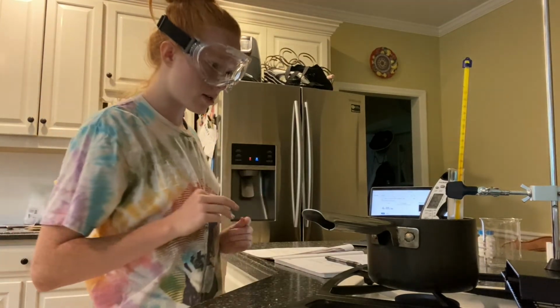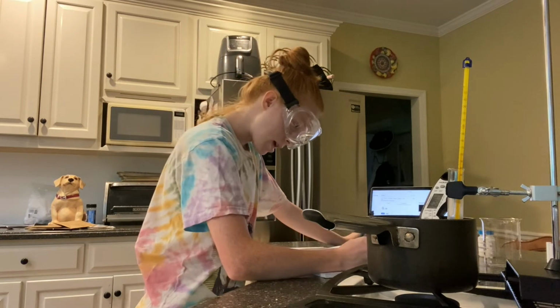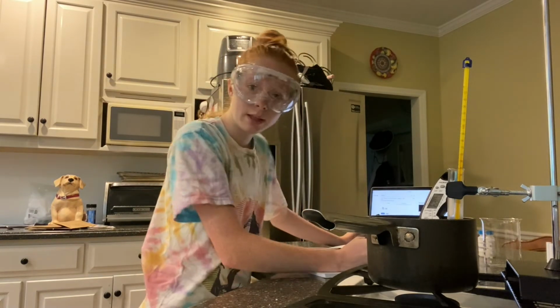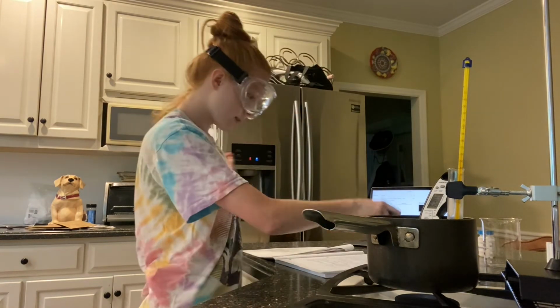All right, it's been 4 minutes and my solution is completely melted and it's at 60 degrees Celsius.